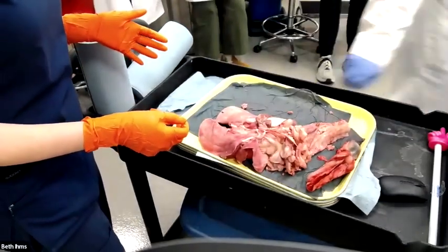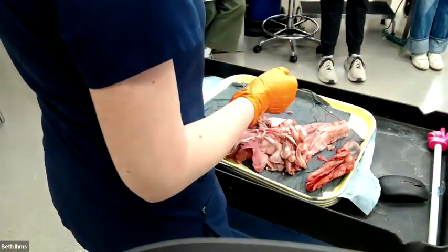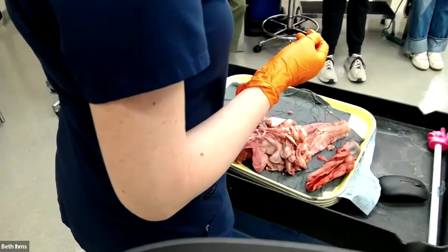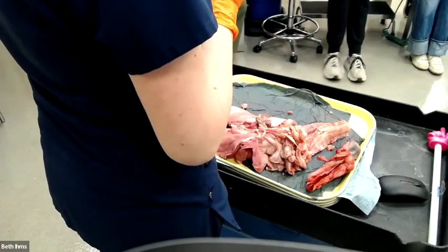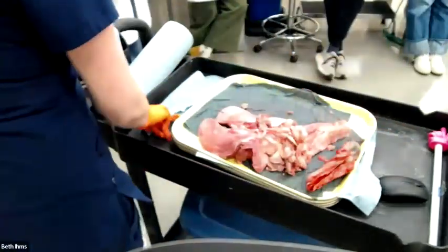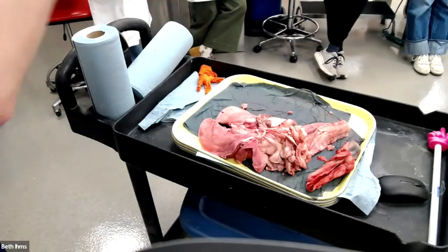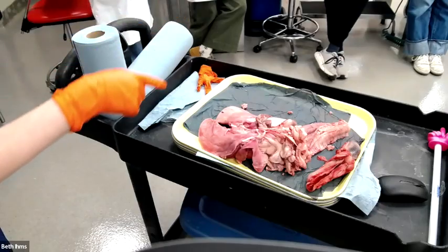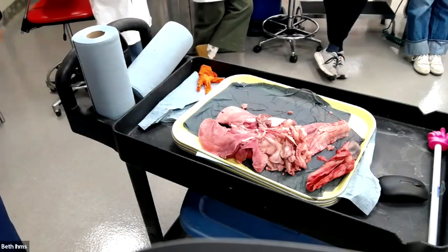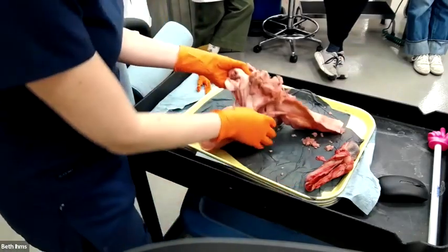Okay, this was a goat. Did everyone meet my friend Barry the botfly? Oh, here, does anybody want him? You can keep him. Fine. Here, pass him around. That came from the horse stomach. That is a horse stomach bot. They are so common. Almost every horse stomach I open has at least one of those. That one literally only had one. Yeah, all the time. Love to hate them.